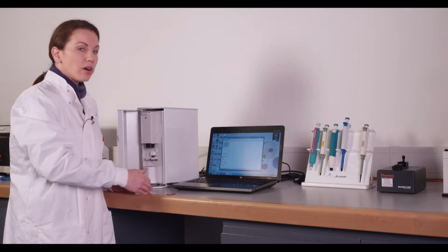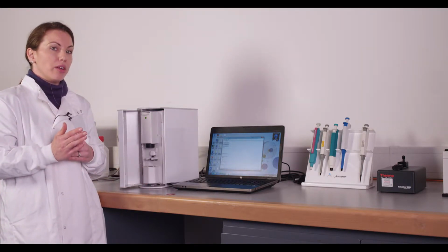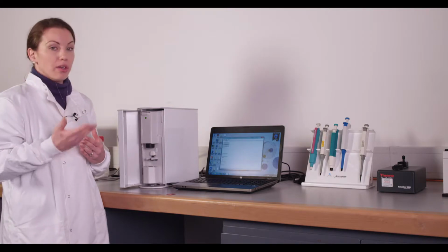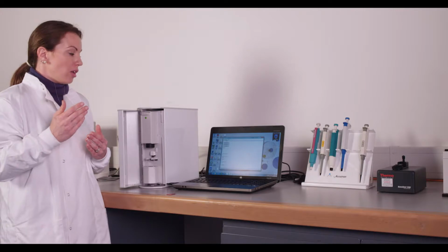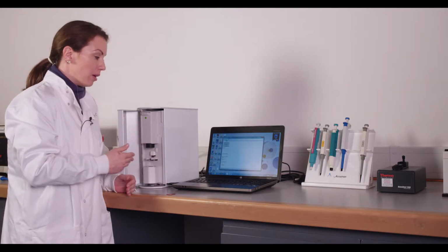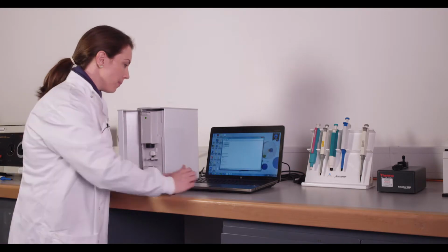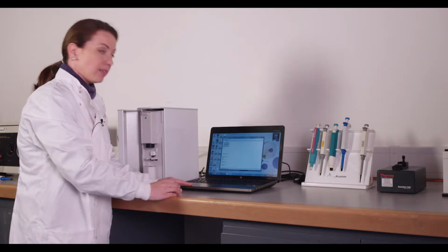So if you're looking at a crossover frequency, or what we call the dispersion, if that happens where you're not seeing any negative points, for example, you may need to adjust your lowest frequency. If you're seeing too many high frequencies, you can adjust your high frequency to be lower. But this is a standard range that works for most cells. Then we'll load our chip and we'll start the experiment.